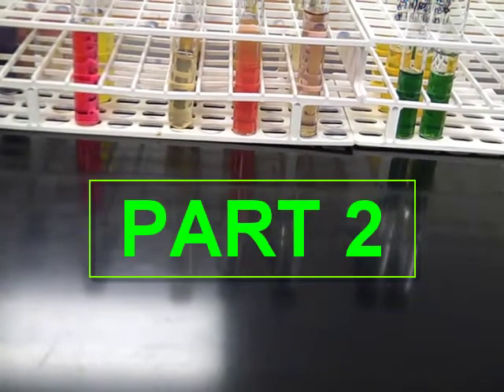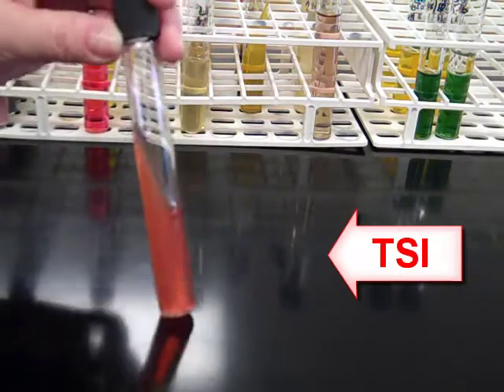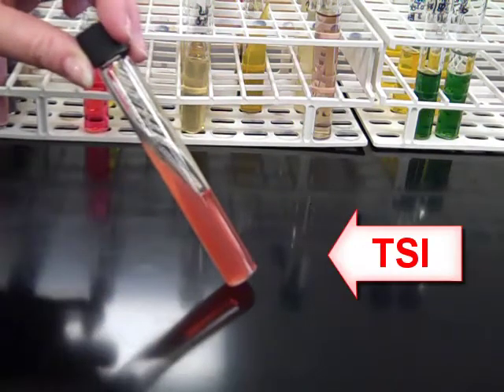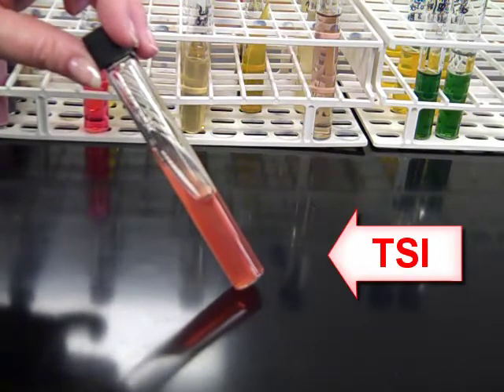All right, we're going to go ahead and check out the tube media for microbiology. Our next tube of interest is going to be TSI, triple sugar iron. This tube has a butt and a slant portion. When we inoculate with the needle, we stab the butt and streak the slant.